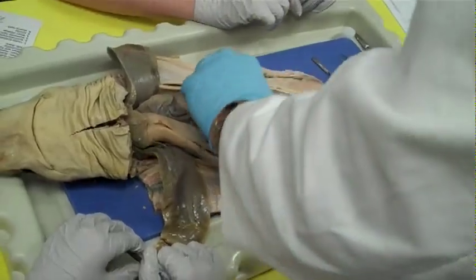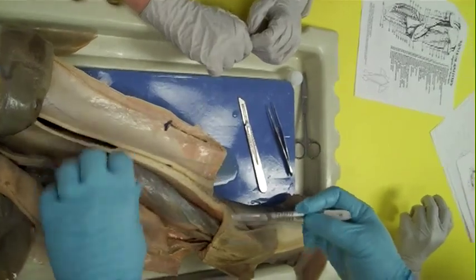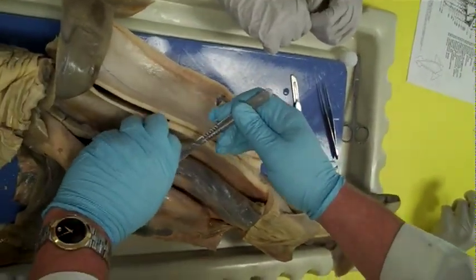Last but not least, baby time. These are really big eggs, which means it's possible we're going to find lots of little embryos, or we might find more.